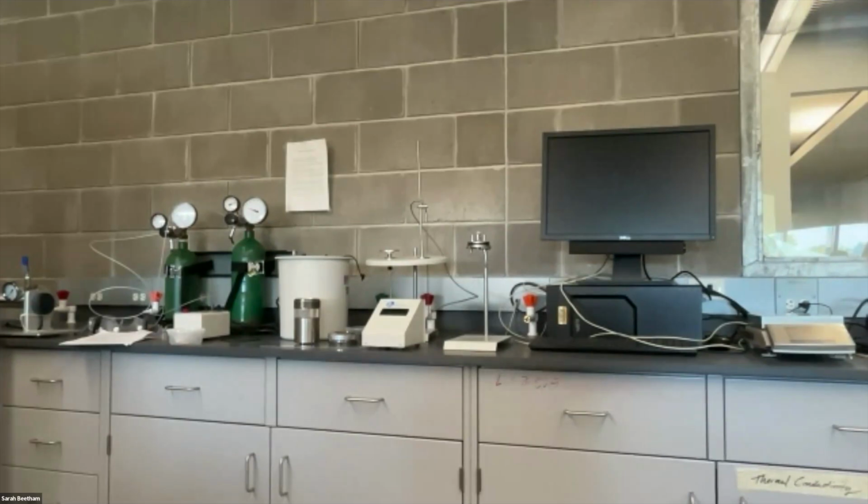All right, and then always measure based on the meniscus. So it's moving. Okay, that's pretty good. So here's 1,000 milliliters.